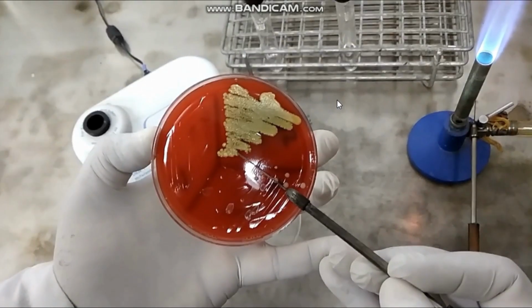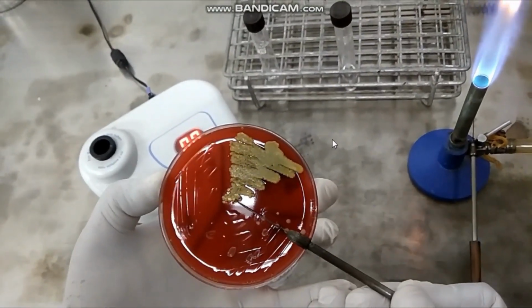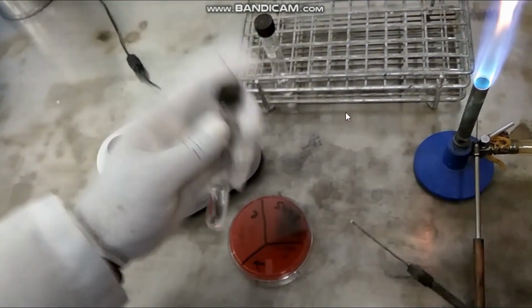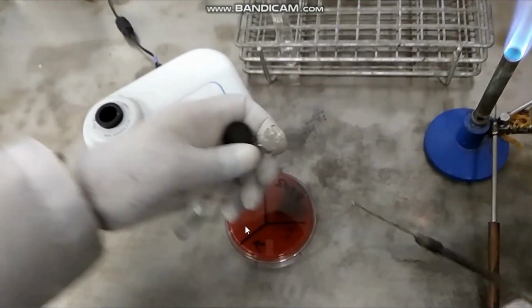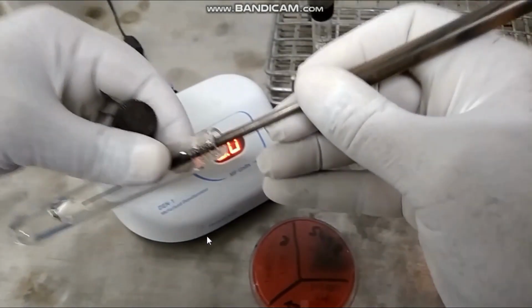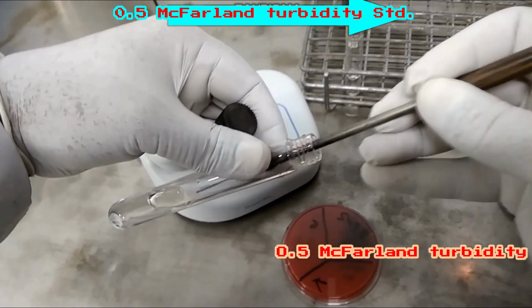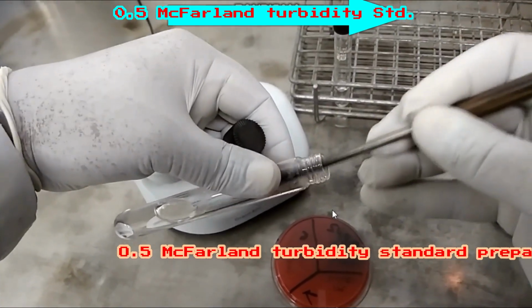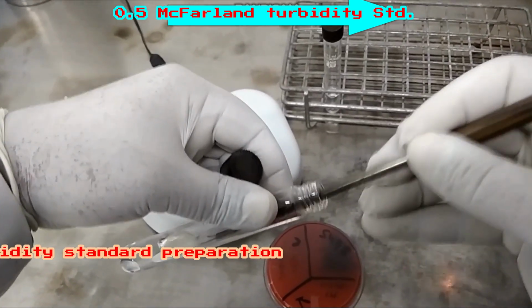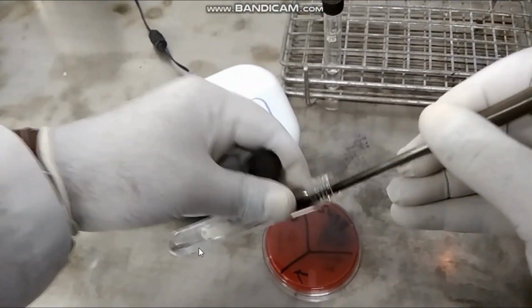So we will make 0.5 concentration standard in this tube, okay, and we have already measured its density, that was 0. So just touch 3 to 5 similar well isolated colonies from this plate and mix as shown here.